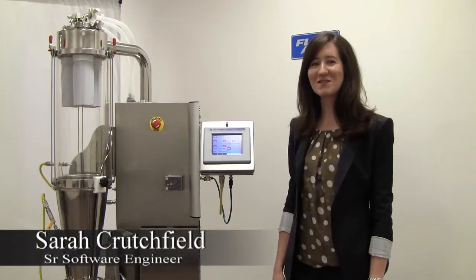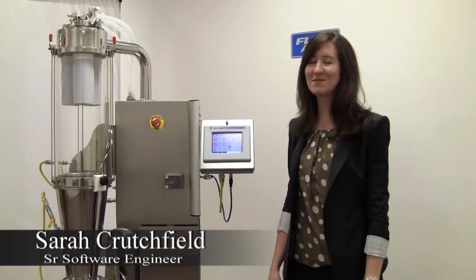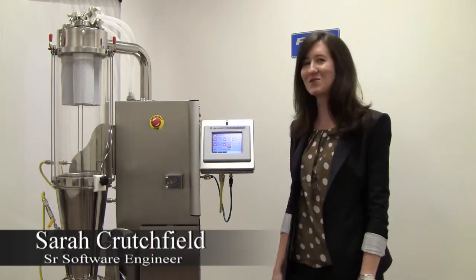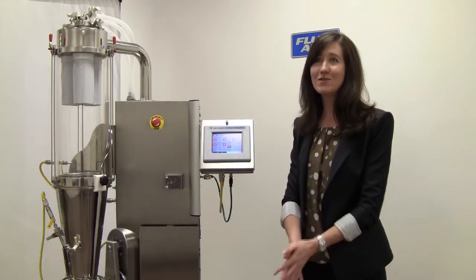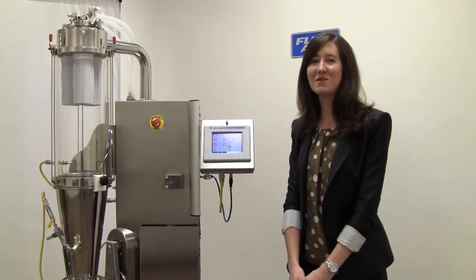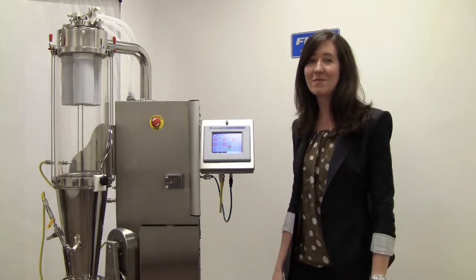Hi, I'm Sarah Crutchfield. I'm here to talk about Fluidair's Batch Architect control system. It's typically used to control Fluidair lab scale equipment.